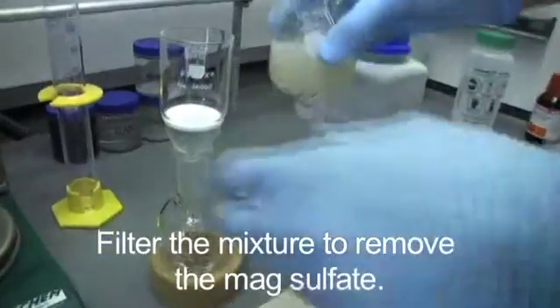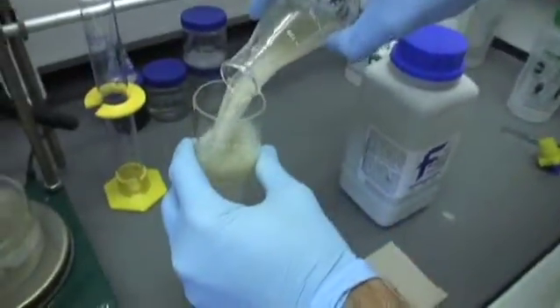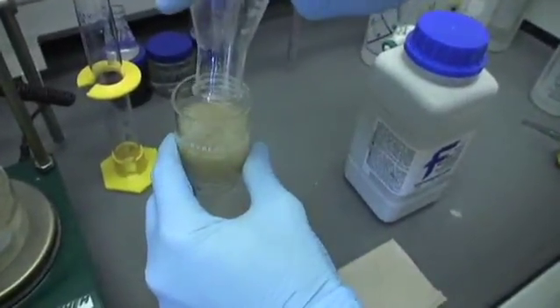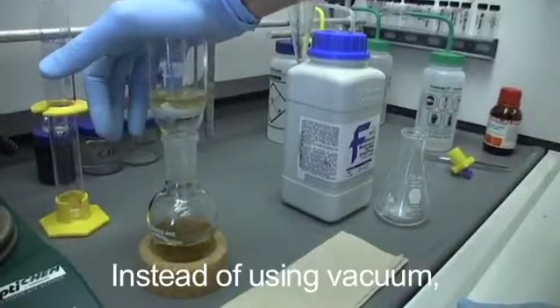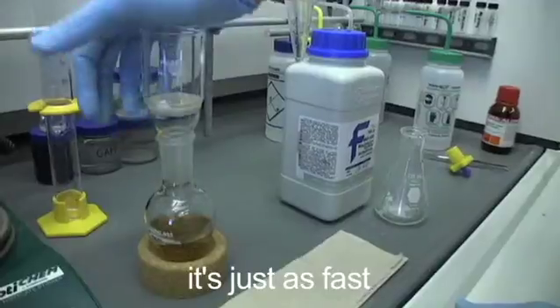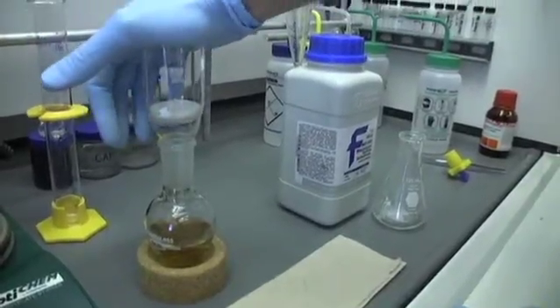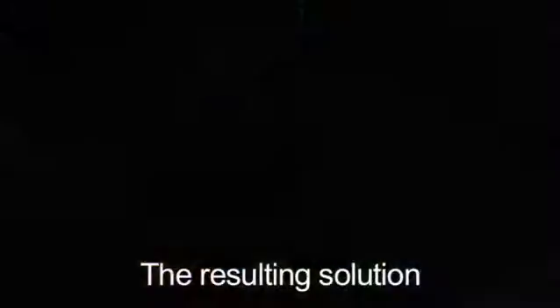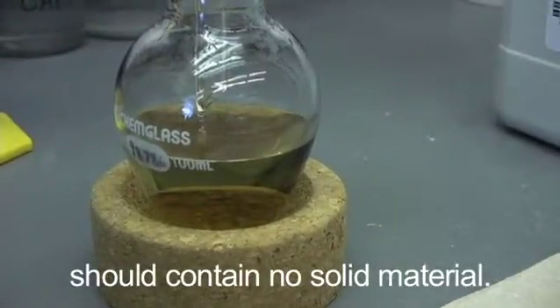Filter the mixture to remove the mag sulfate. Instead of using vacuum, I like to push with the palm of my hand. It's just as fast. C3PO taught me that trick. The resulting solution should contain no solid material.